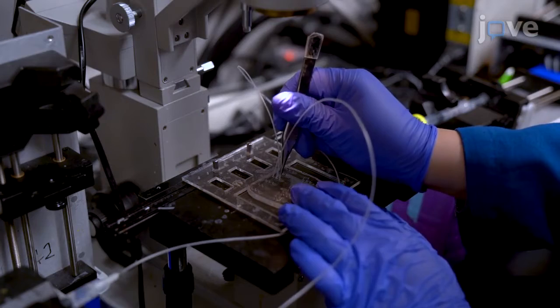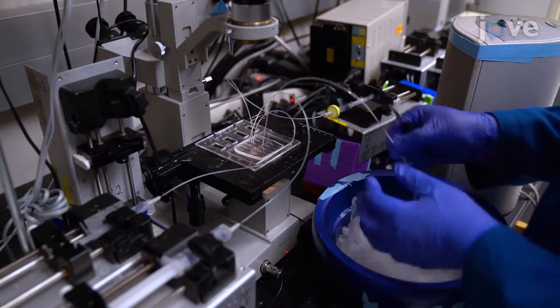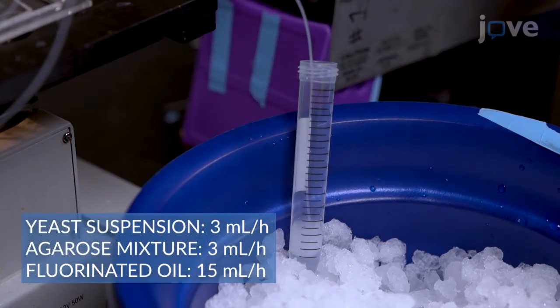Connect the tubing from the syringes to device A. Place a 15 milliliter conical tube in an ice bucket and guide the outlet tubing into the conical tube. Set the flow rate for each syringe and collect approximately 1 milliliter of emulsion in the 15 milliliter conical tube.